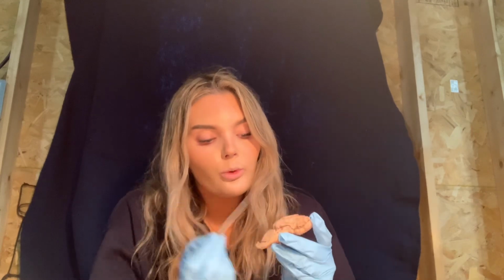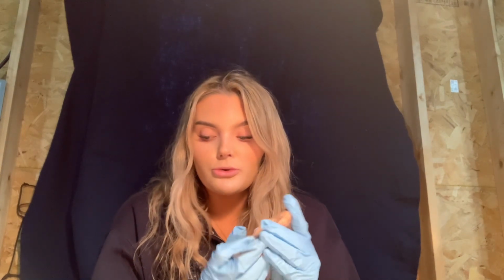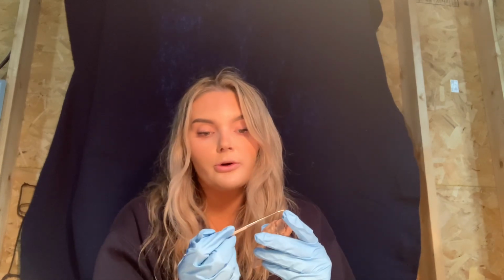And we'll go to the corpus callosum, which is here, and it is a large band of nervous tissue that connects the two cerebral hemispheres together like this. And we also have the cortex. The cortex is the outermost portion of the cerebrum. And we have cranial nerves, and there are 12 cranial nerves that leave the brain.